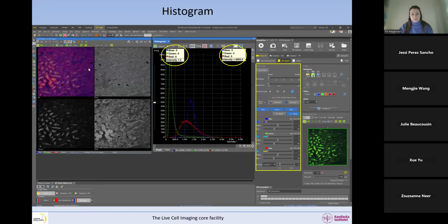We are influenced by the background. So it's difficult to see this image and think, something is wrong, my background is not dark. But this is a correctly acquired image, and then we can do something about it afterwards. So here there's no saturation at all, there's no underexposure at all in the areas of interest. This is something that is important.